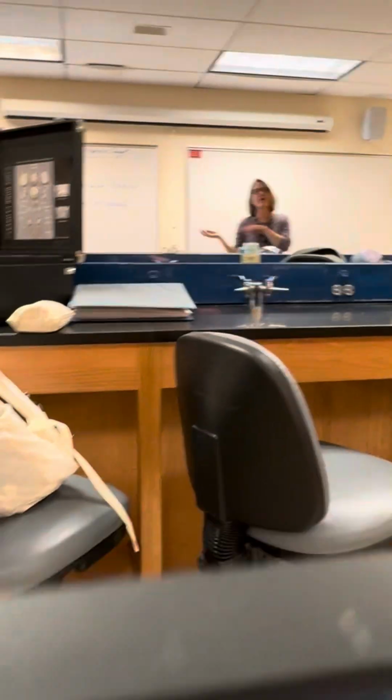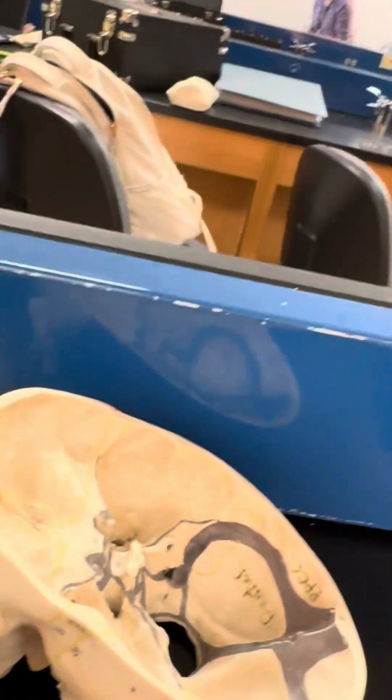Do the epithelial ones first. I'll mix them up a little bit, and then I'll do the others, if that works for you guys. But in real life, they'll probably all be intermixed. You can leave your stuff out if you're still working on it. This will just be a couple of minutes here.